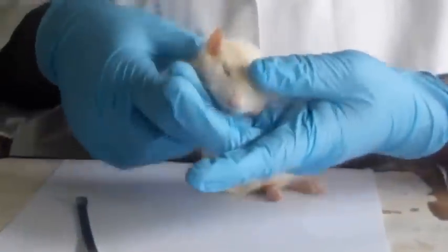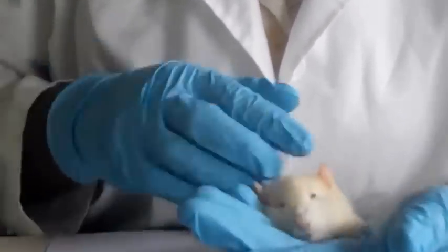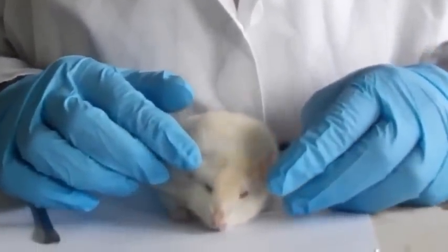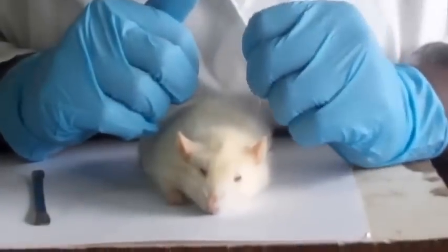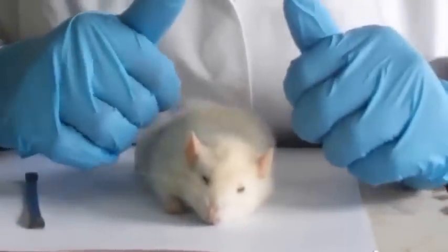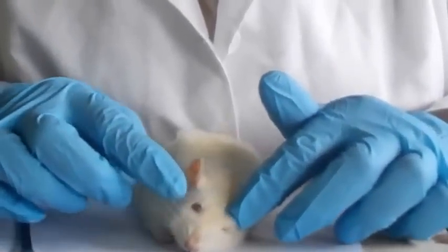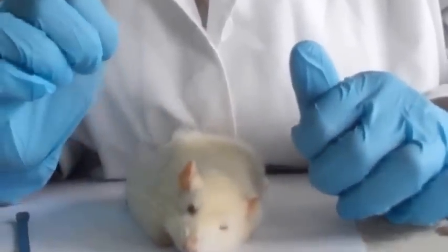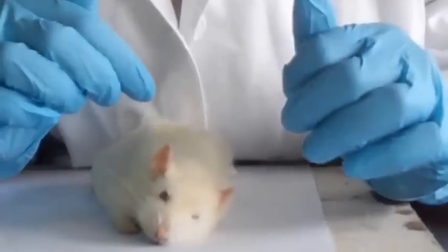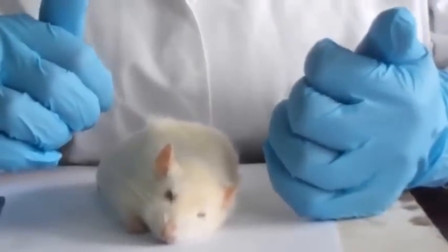They are dorsal. This is the dorsal side, so you can see they are dorsolaterally placed to enable a wide field of view as the animal keeps moving. And then they are well protected with the upper lid and the lower lid. The eyes are also moist to prevent friction as it keeps rotating around.